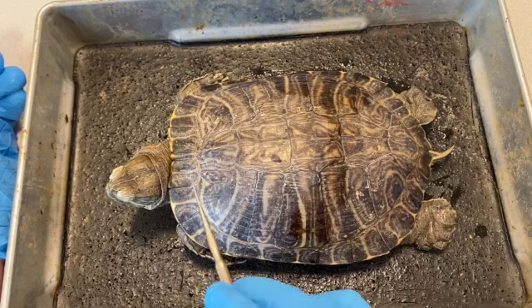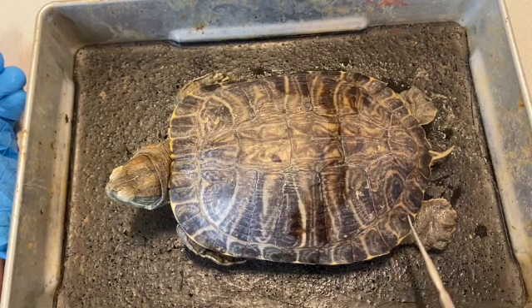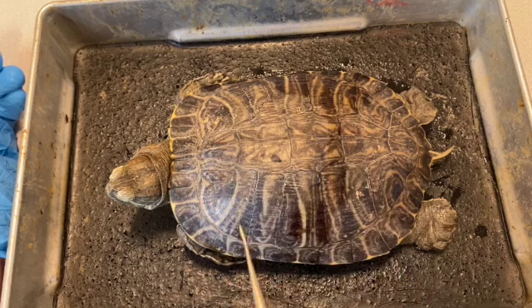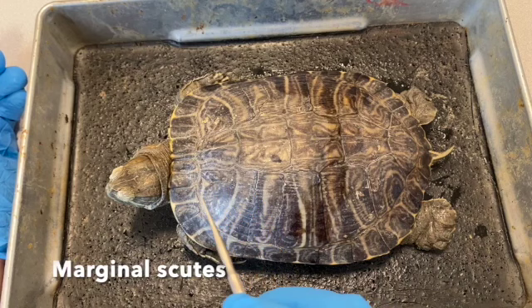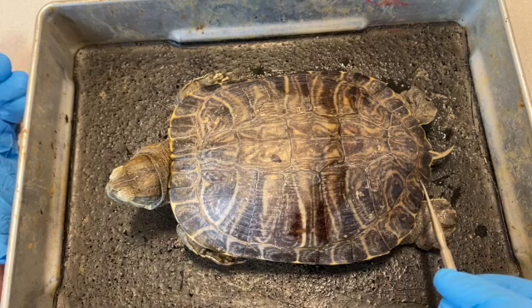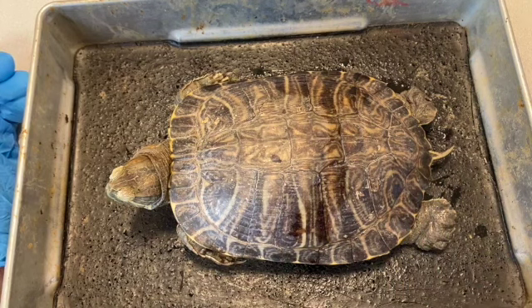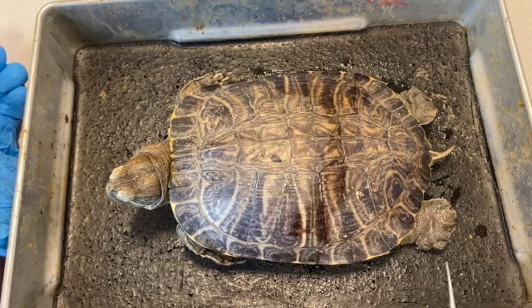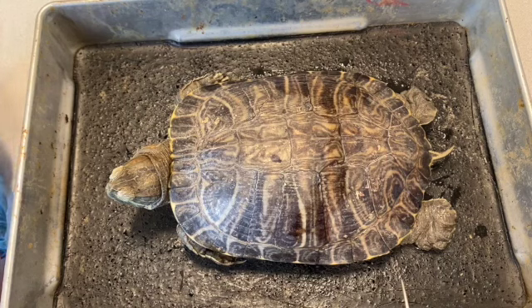Then we have these scutes around the outer edge. This one right here in the middle, as I mentioned already, is the cervical scute, and the marginal scutes are also numbered 1, 2, 3, 4, 5, 6, 7, 8, 9, 10, 11, 12 in this animal. Now there are bones underlying these scutes that you can't see, but they also have specific names and locations.